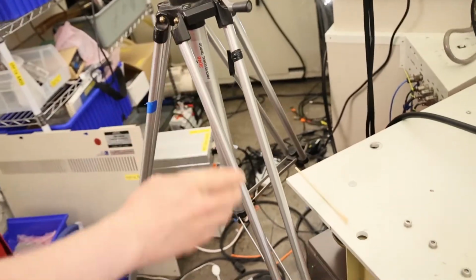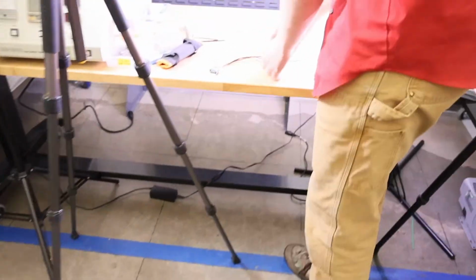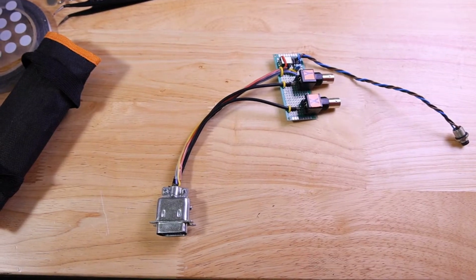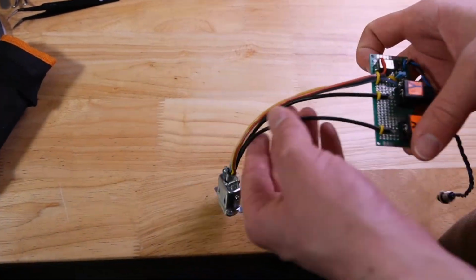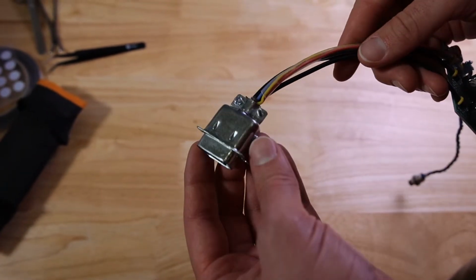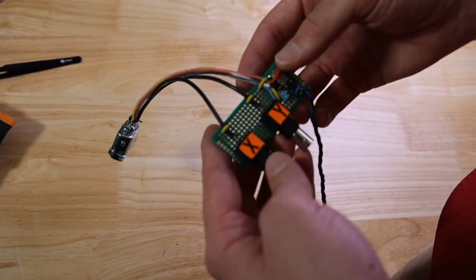So actually, I'm going to show the little board I built to do this. You want to bring the camera over here? So this is a JEOL interface board that I constructed a while ago for this microscope. It's pretty simple. This is the JA7 connector, which many, many JEOLs use, and newer JEOLs have a D-sub version of this, basically. It's got some scan pins on it, and also some external enable and external blanking pins.